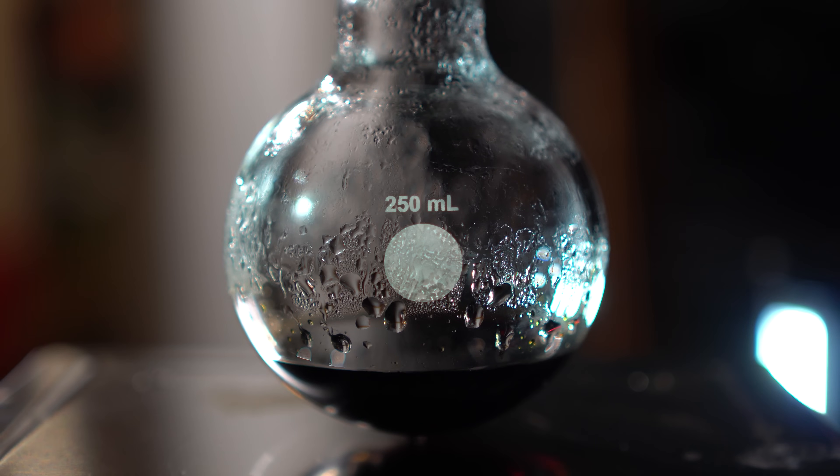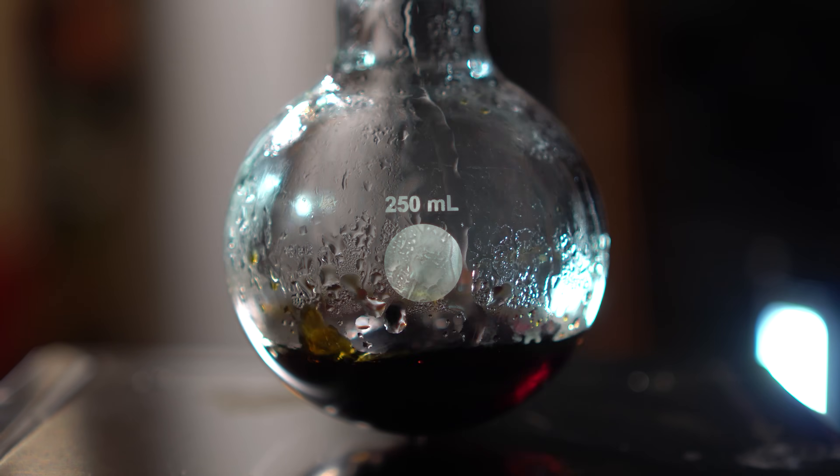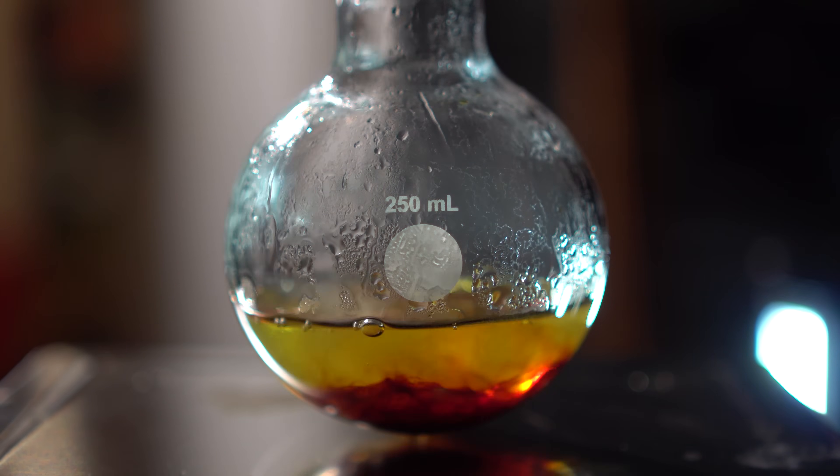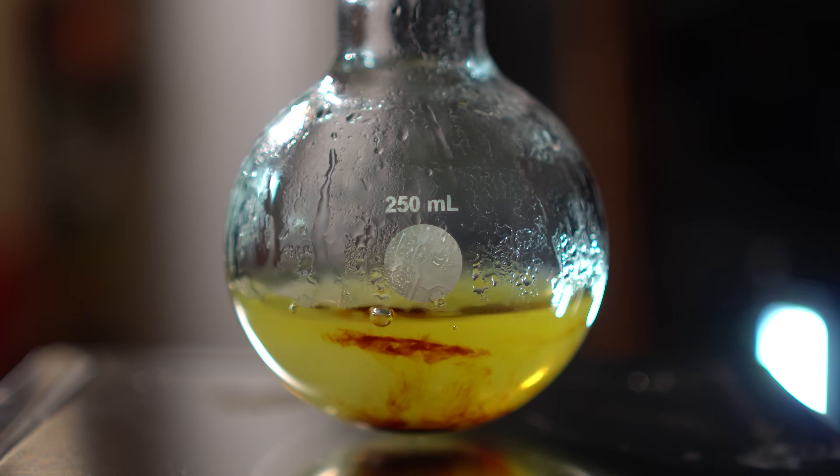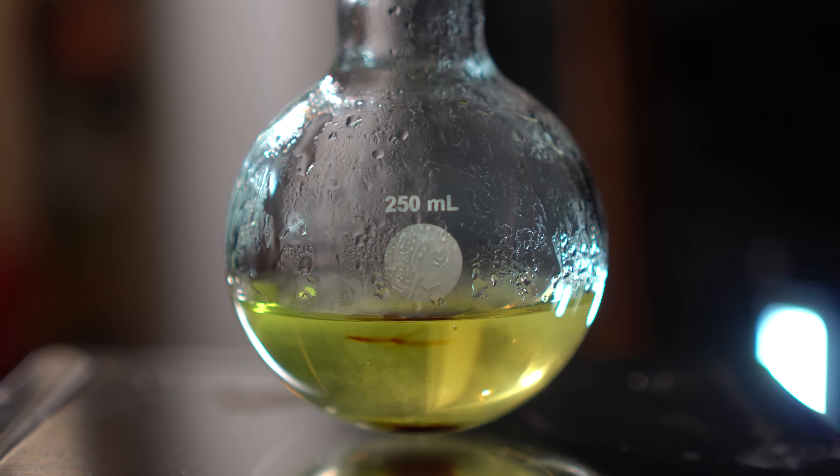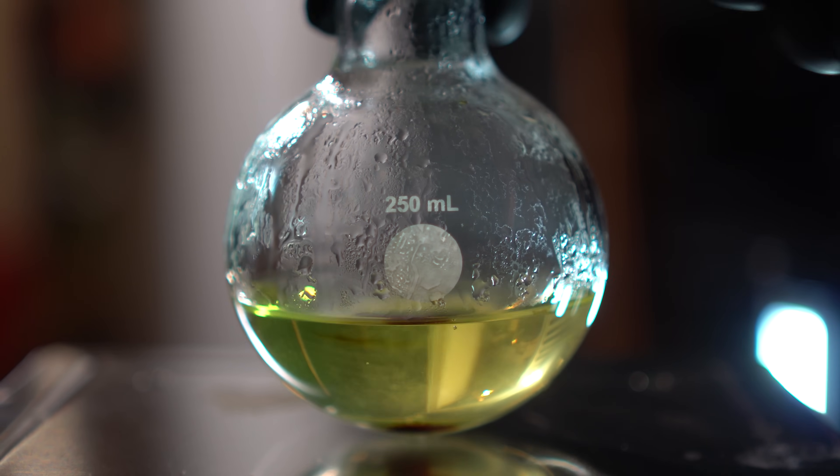I decided to destroy what I had remaining, as it wasn't pure anymore. I did this by adding a solution of sodium hydroxide, with a little bit of sodium thiosulfate dissolved in it. I swirled the flask around, and added a little bit more of the sodium thiosulfate solution to it. Everything was put into a chemical waste container, and all my glassware was washed with sodium hydroxide and a sodium thiosulfate solution.